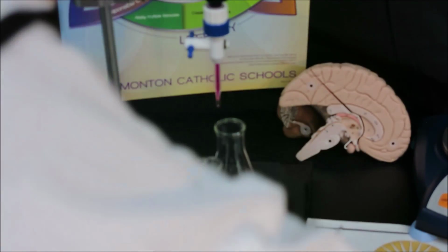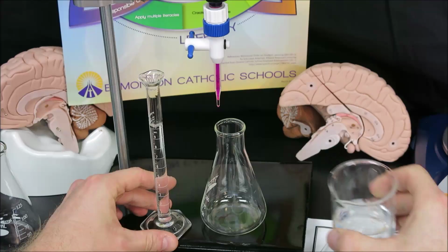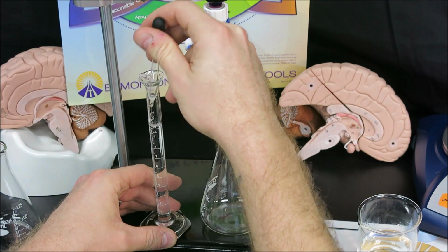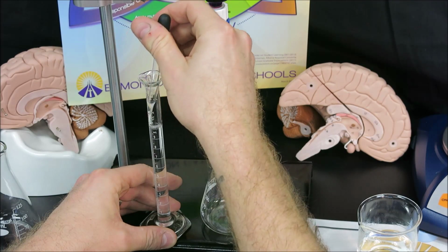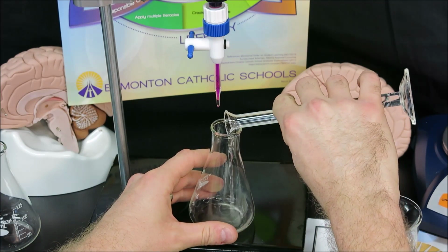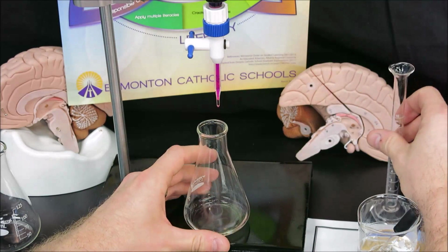We need to measure out 10 milliliter samples, and it's very important again to use the meniscus. Because it's often hard to get it exactly on 10 using the beaker, we use an eyedropper to remove or add volume as required. Once we have exactly 10 milliliters, we pour that into our Erlenmeyer flask. And we're prepared to titrate.